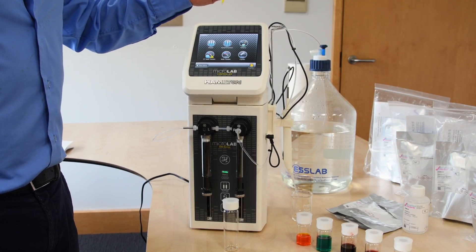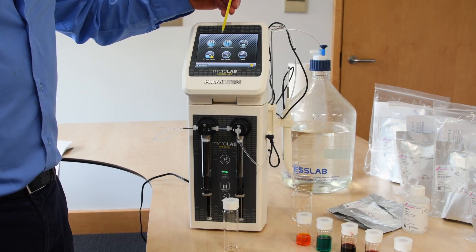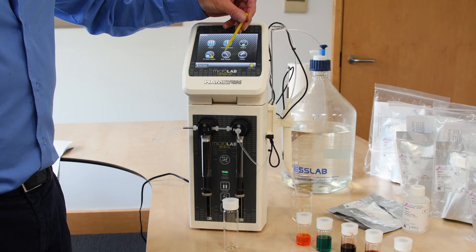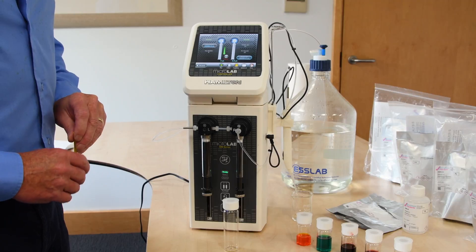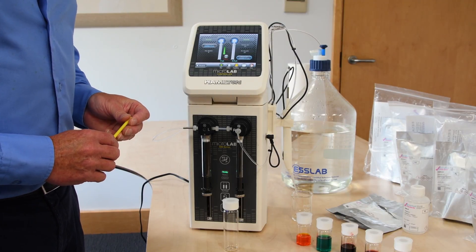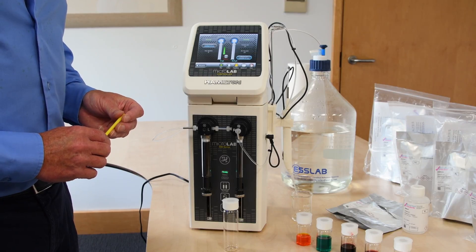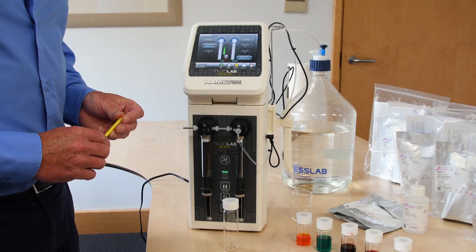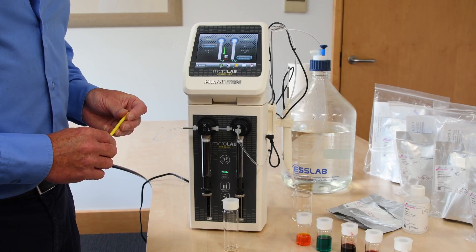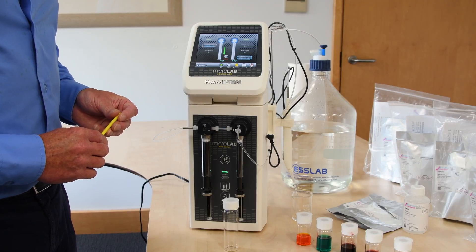We're going to look at one of the wizard functions, which is the multi-sample preparation. This is how we select it in the wizard program and it initiates the screen. As we're not in a laboratory environment today, I'll demonstrate the process using coloured food dyes so you can see the differentiation of sample pick-up, going through the process you would use in a laboratory environment.